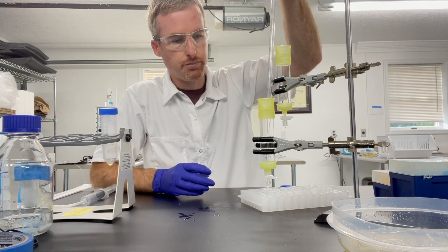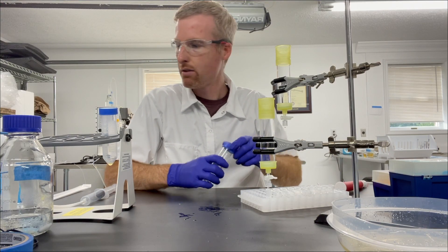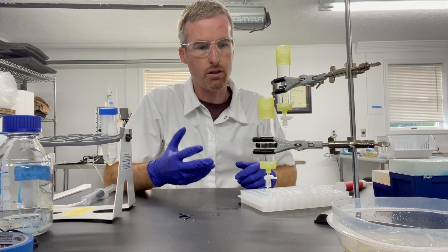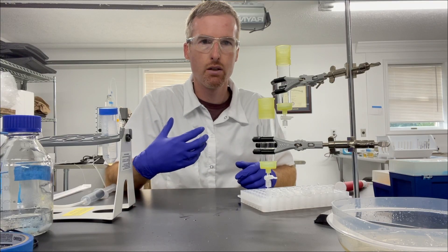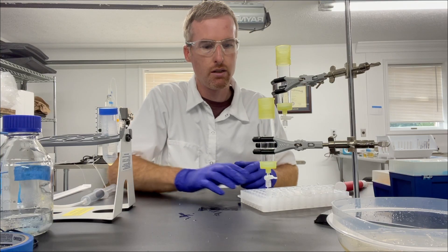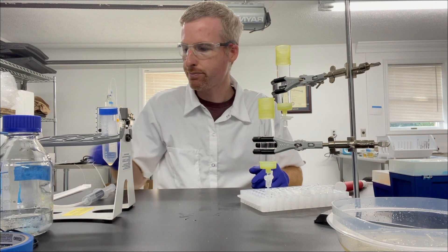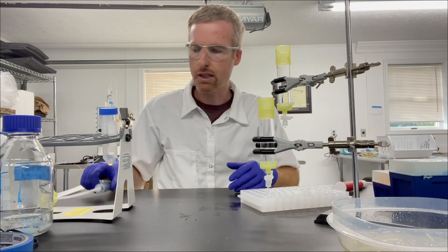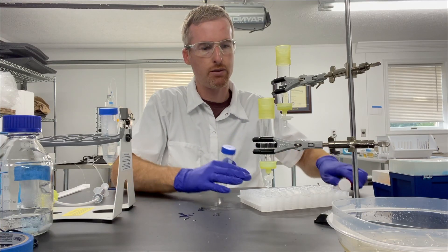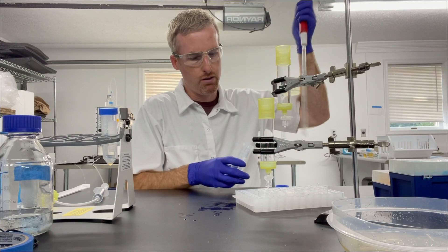And what I'm going to do is wait about a minute for the proteins to start unbinding from the nickel agarose, give it a chance to equilibrate, and then I'm going to elute it into my microfuge tube. The first one never has protein in it because the concentration of imidazole isn't high enough, but usually the second one does. So this is going to be the money fraction.